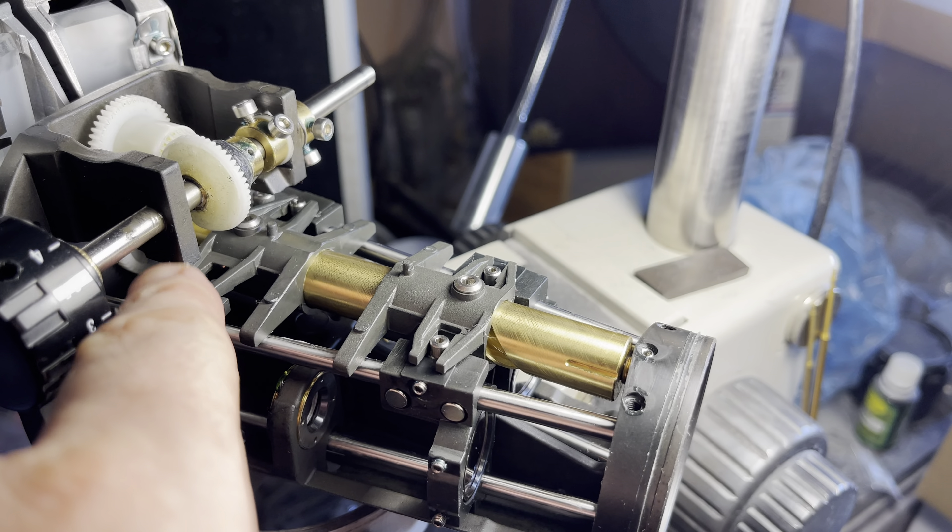The rods are limited by bronze rings, and the same connection is used for the gear. The most dangerous situation for the gear is that, due to the pretty strong tension needed to make the zoom system work, there are constantly very strong forces trying to crack those gears.